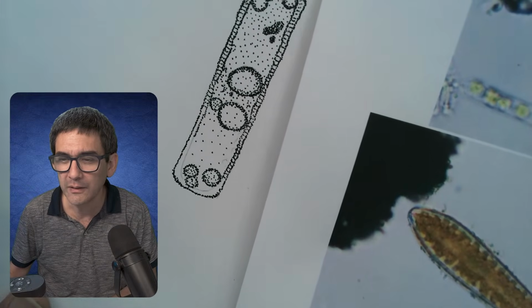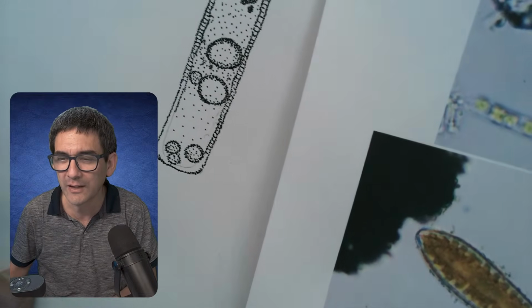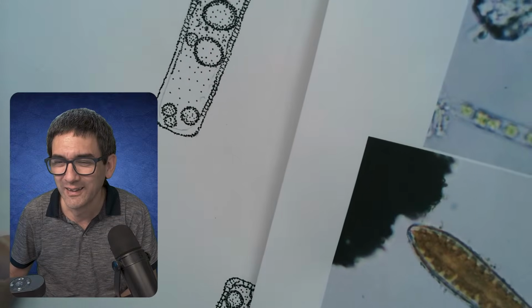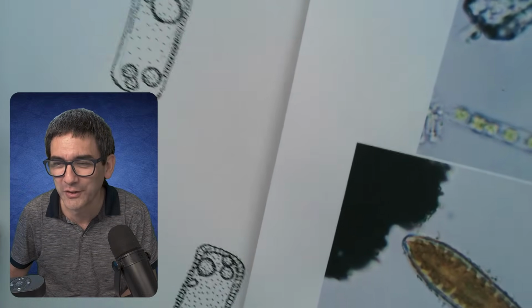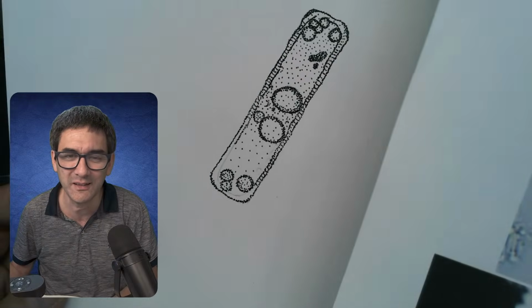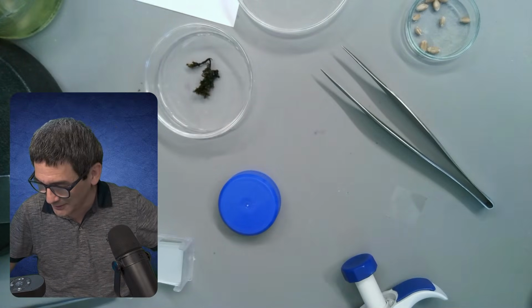Okay. I'm just reading your comments here. No, not Lacrimaria. This would have been nice. So yeah, Tini Coco almost thought that it was a Lacrimaria. Lacrimaria are single-celled organisms with a very long, extensible neck, very fascinating to look at. I have not found so many of those, unfortunately, yet.